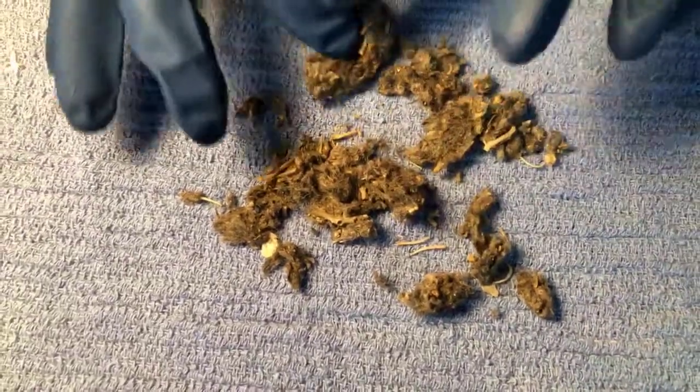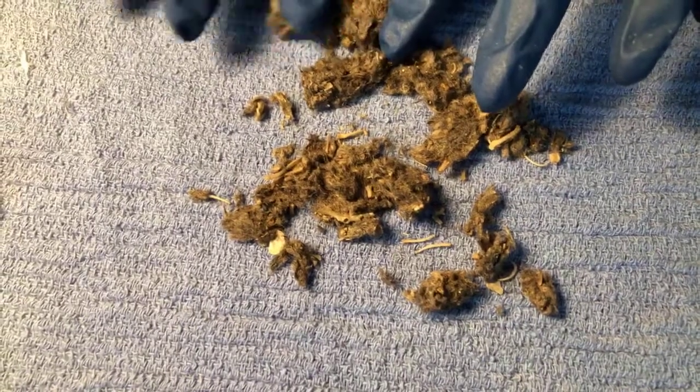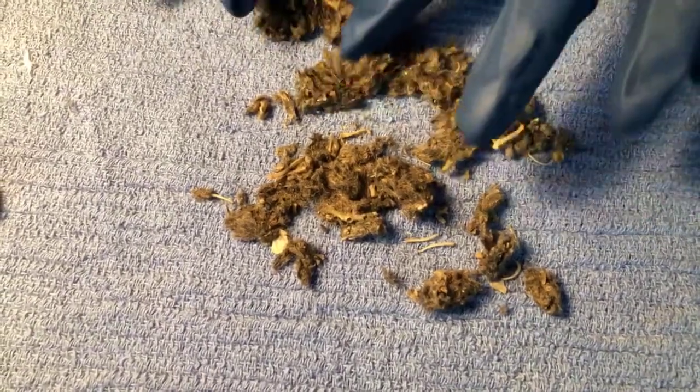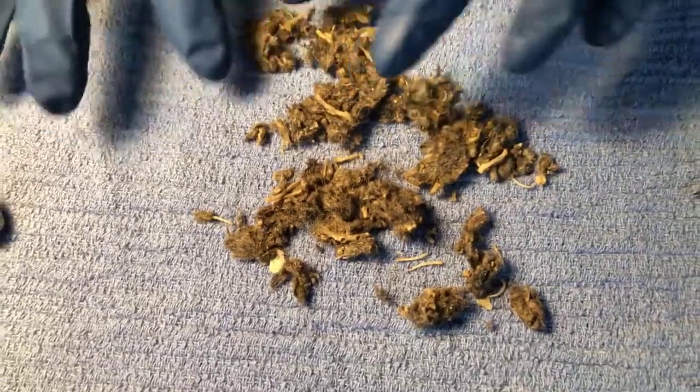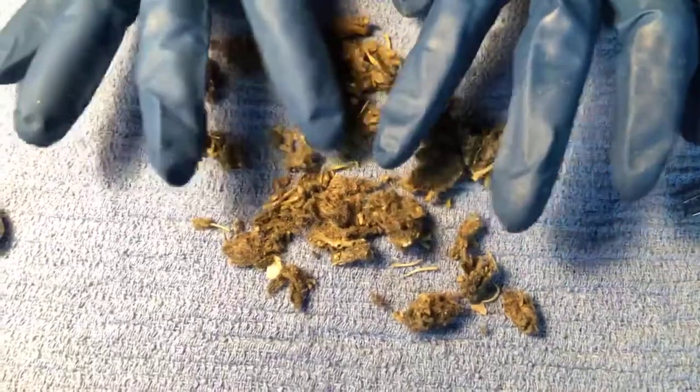And what you're looking at is actually several different mice. So this was probably 4 or 5 different mice. So he would have eaten all of them in a meal, and then collected it all and digested it. So you can see that there's tons of different types of bones in here.